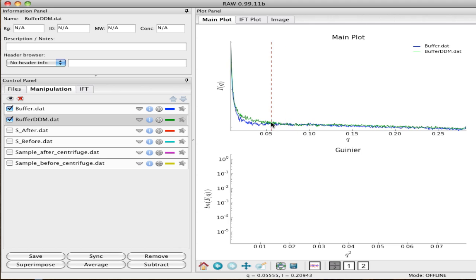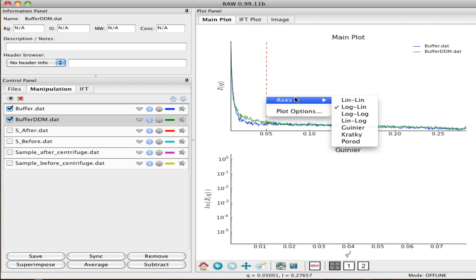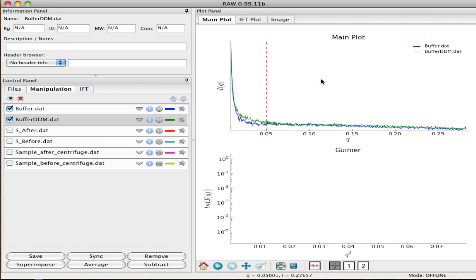I wanted you to see this example because blue is a characteristic buffer. It's just sort of flat and uninteresting. This is a buffer without any detergent in it. And then with the detergent added, you can see that it goes up, comes down, almost touches where the buffer is, and then it comes up again. This is very characteristic of micelles in solution.